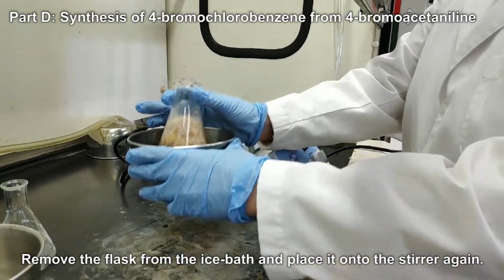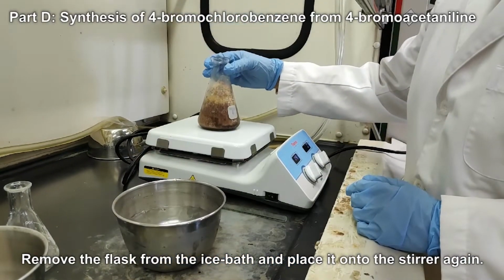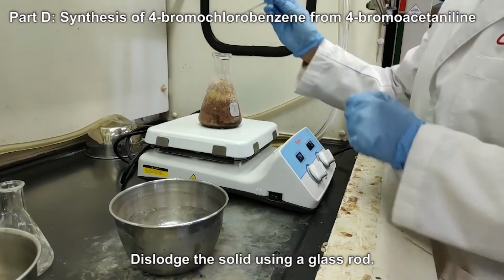Remove the flask from ice bath and place it onto the stirrer again. Dislodge the solid using a glass rod.